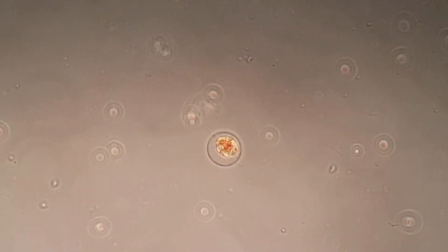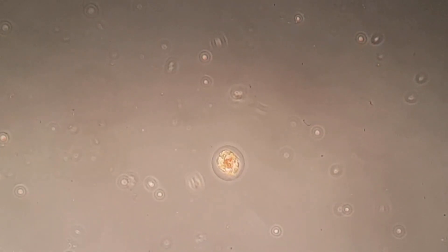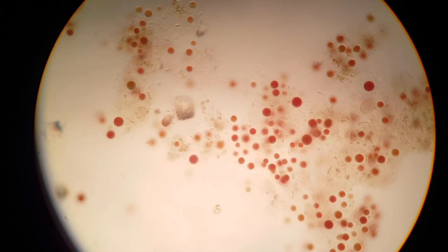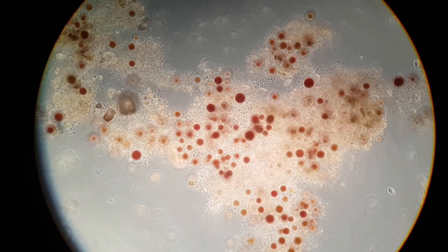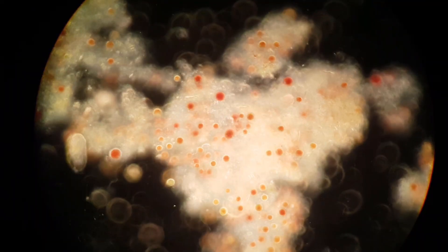Here, magnified 160 times, we see the last microbe I want to focus on. There are a few of them in this shot. They look like clear balls with a tiny colorful ball inside and two tentacles sticking out with which they move. This is a sample collected deep in the water column. Those tentacles are actually flagellae and the microbe is an algae called Hematococcus. Here we have some intensely red balls — these are also Hematococcus, it's just that these are in cyst form.